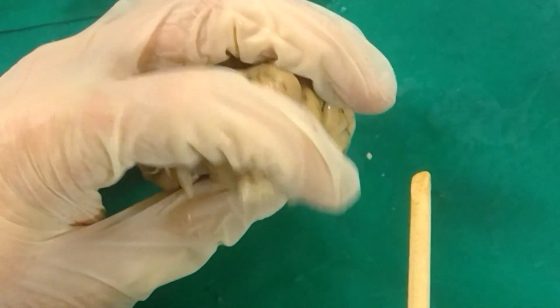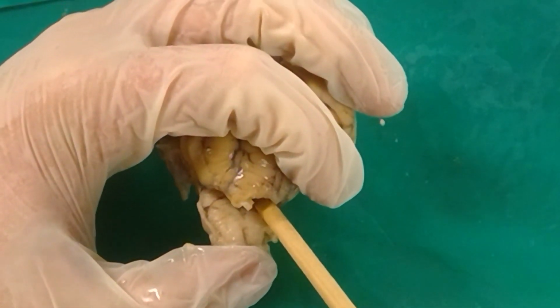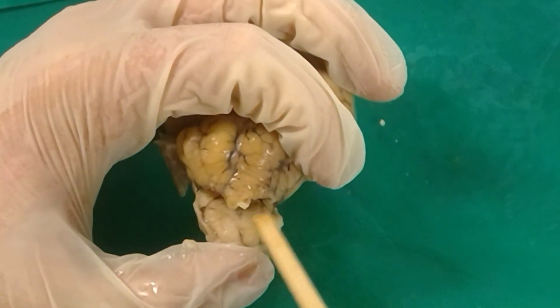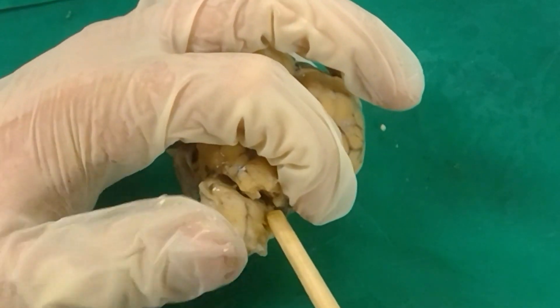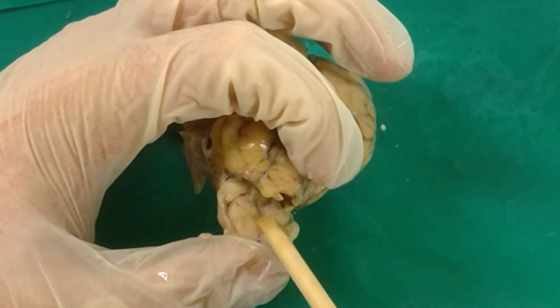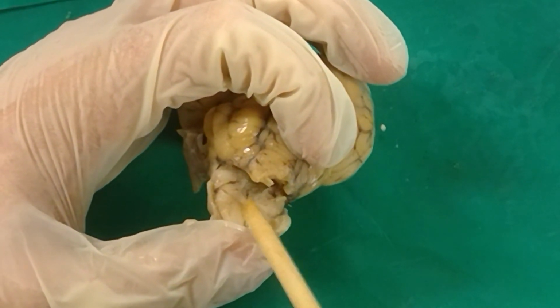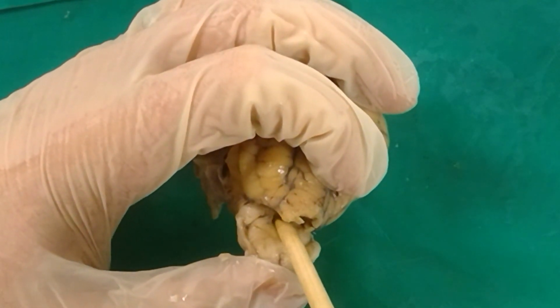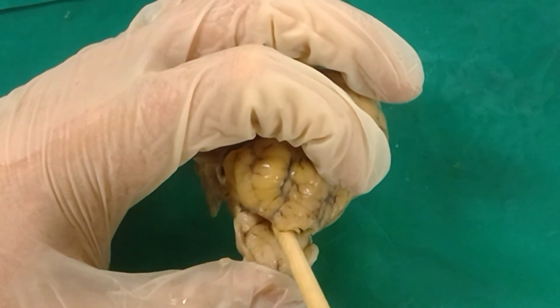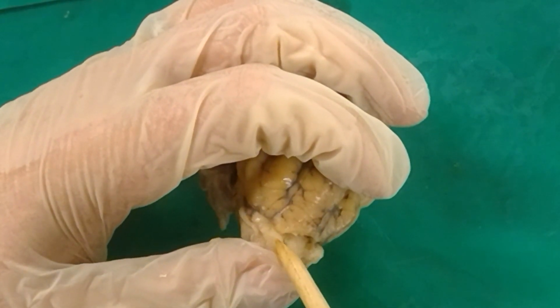And if we move this way and pull this back, you can see a V shape happening here. So there's that line coming together at this tip of the V. That is known as the obex, the tip of that V shape. This side and that side come together at the tip of this V. That's the obex. The space inside the brain right here is the fourth ventricle. So between the cerebellum and the brain stem is the fourth ventricle if we're looking at a space inside the brain. Outside the brain, this is the cisterna magna.